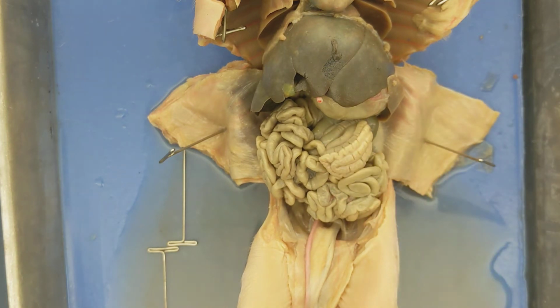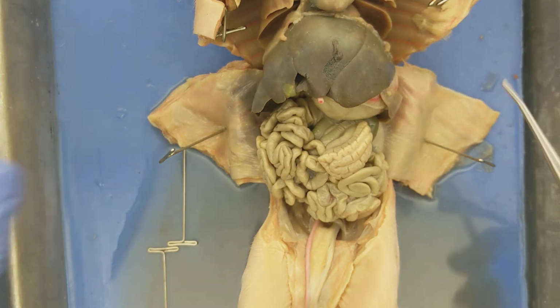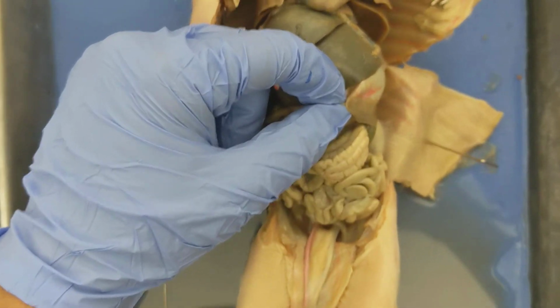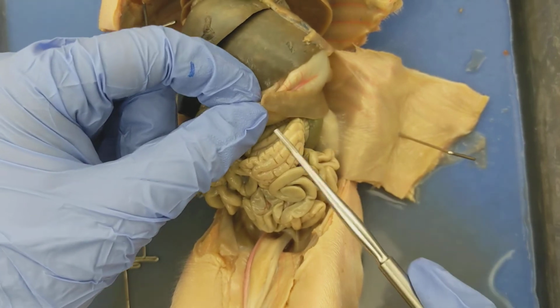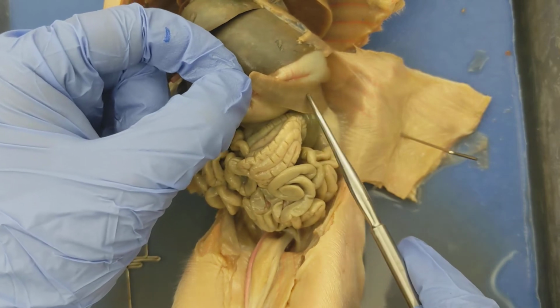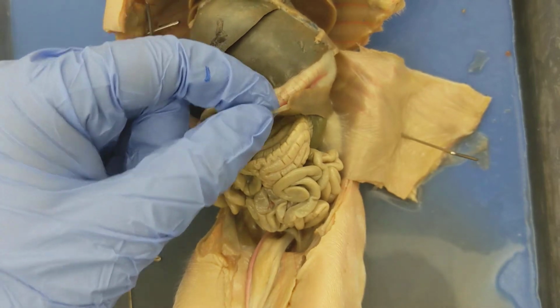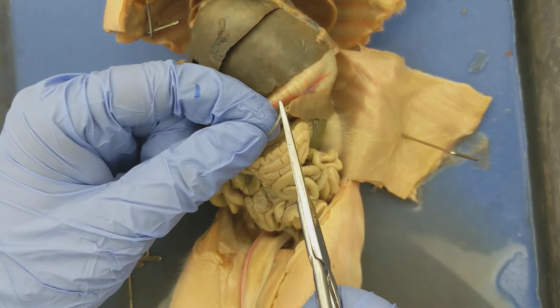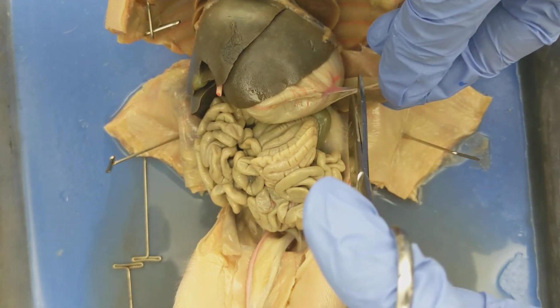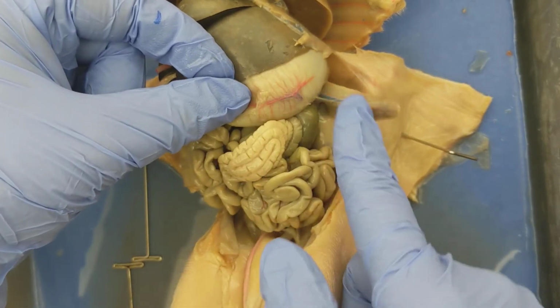Another structure besides the intestines that you can see here on the surface, I'll pull it apart, is this little structure here. Looks like a tongue. Let me see if I can get a better view with my camera there. There you go. So this structure here on the side, that looks like a tongue that my probe is touching, this is the spleen. I have a bit of connective tissue right now that is connecting the spleen to another organ, so I'm going to just snip it there so that we can push it to the side. There we go.